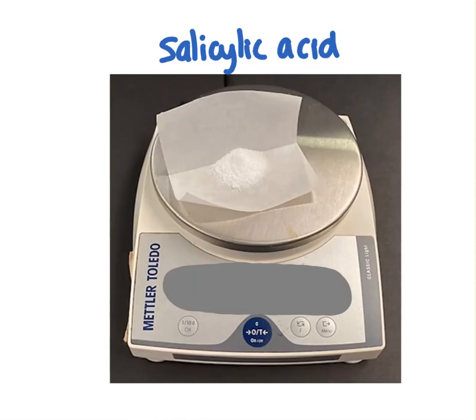Then we're going to weigh out about 2 grams of salicylic acid. We'll watch the number, but we're not going to really write that one down, because we're going to get the true mass of the salicylic acid that actually makes it into the flask, so we'll be more sure. And you may notice that salicylic acid is a white powder, like a lot of organic acids are.